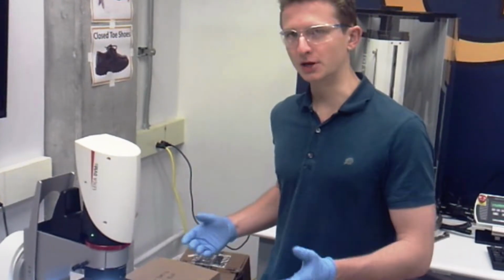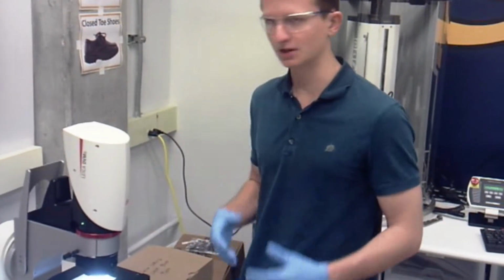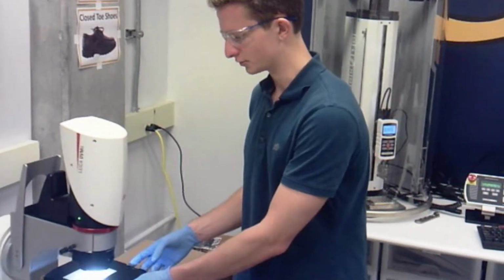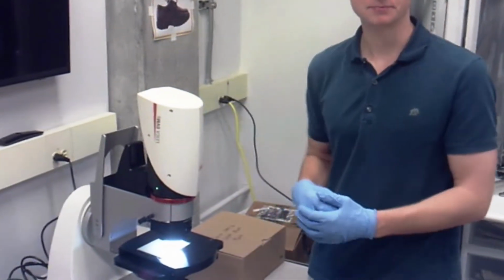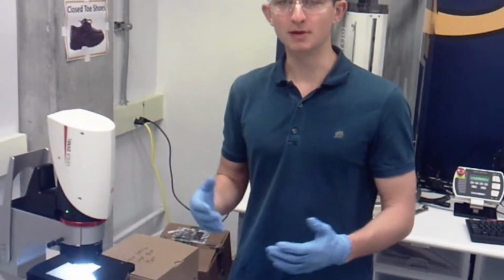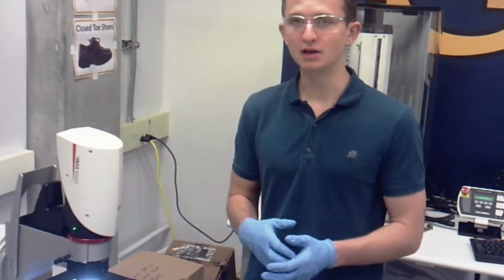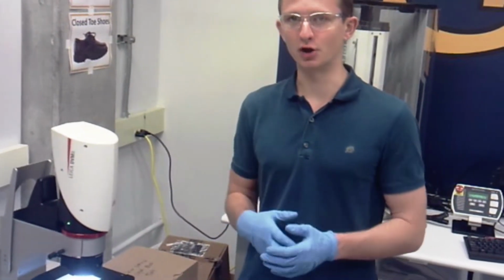The main elements of the microscope here are the objective of the microscope, which holds the optics that we use for magnifying on our sample, the sample bed here, which can be moved around, and the head of the microscope here, which can be rotated. On the microscope, there are many knobs and dials to take note of that will allow us to adjust our lighting and better improve our images.